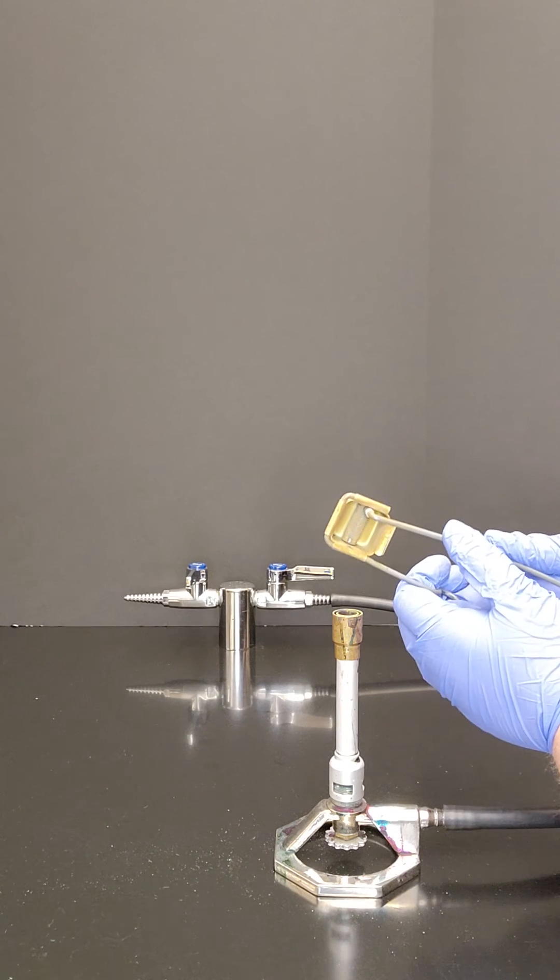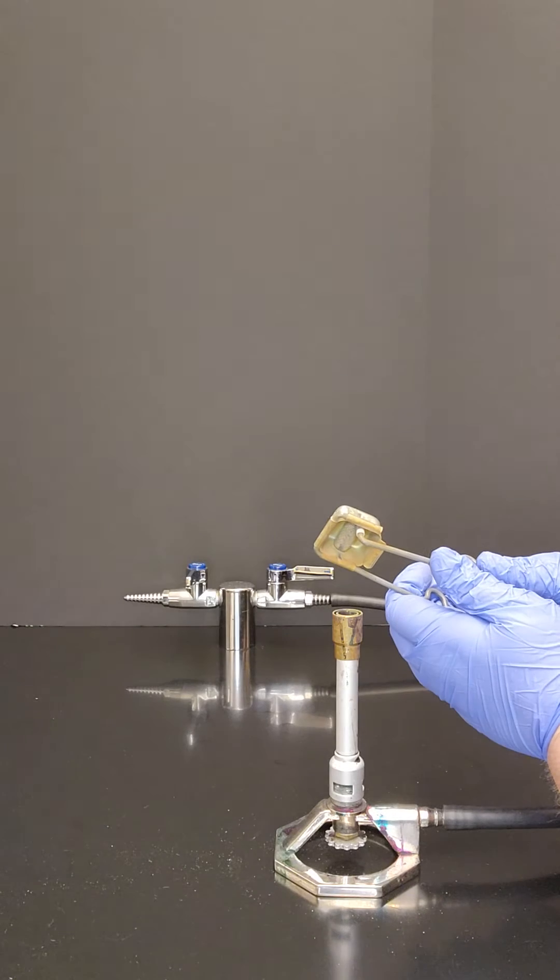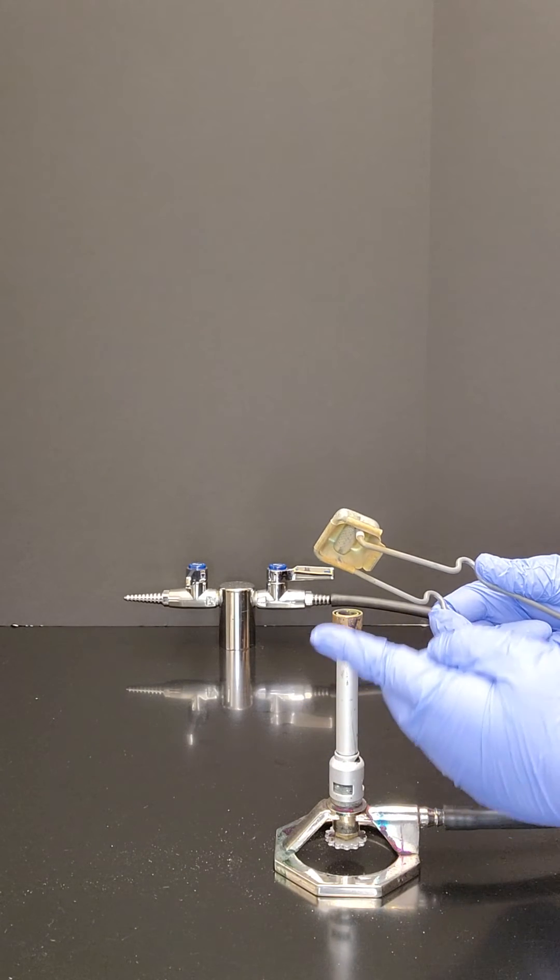Hold your striker just above, just behind, and at an angle above where the gas is coming out.